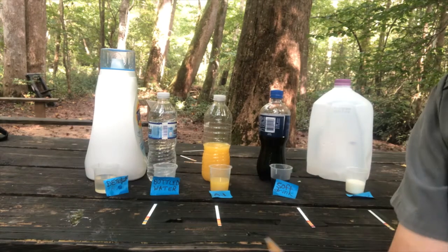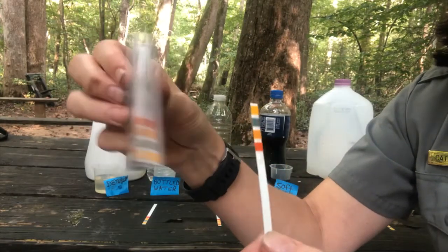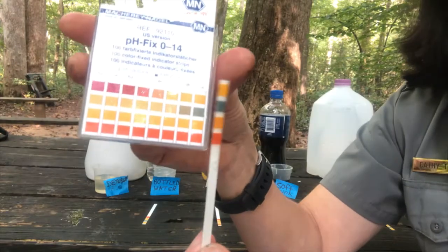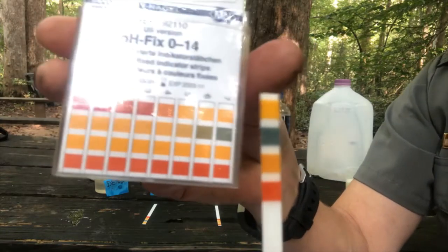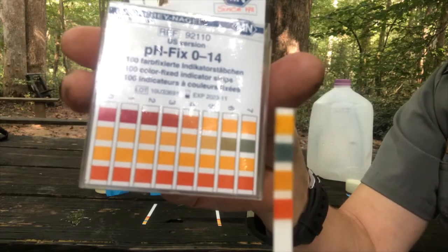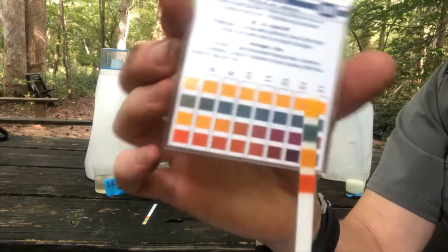And I'm going to take the strip for detergent. And I'm going to start, I think, with the 0 to 7. It just sort of makes sense to do that. And first of all, I'm noticing some green. I usually try to start by looking at the green. 6 and 7 have green on this chart. Let's look at 7 through 14.